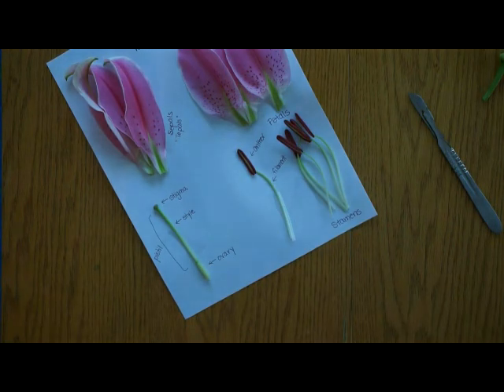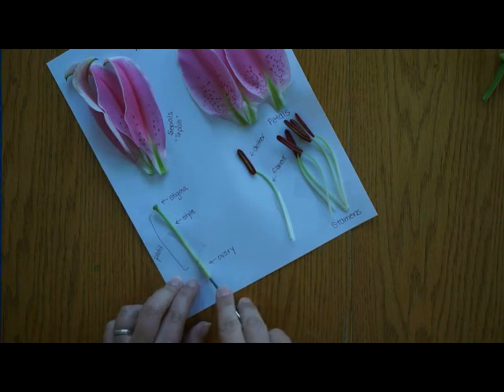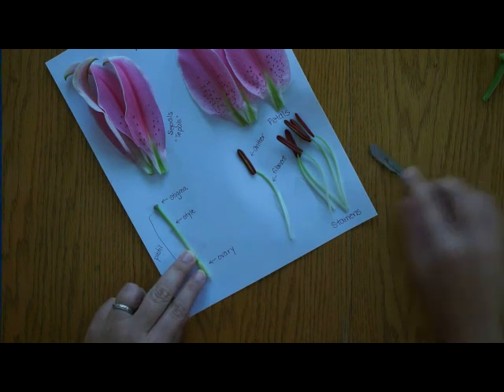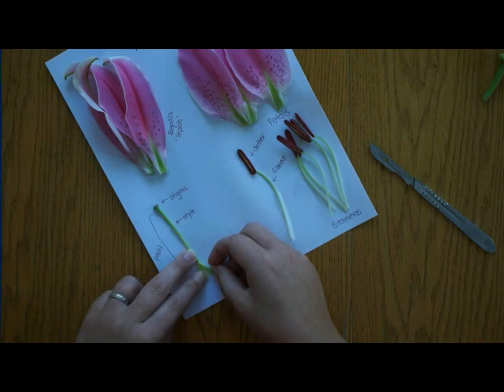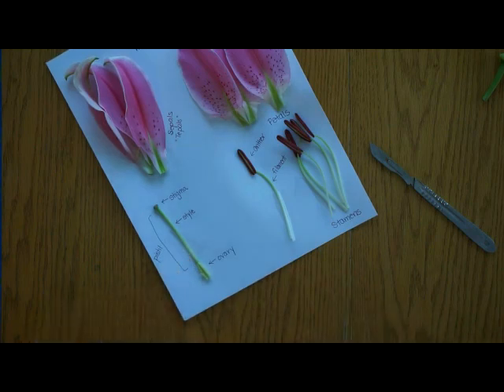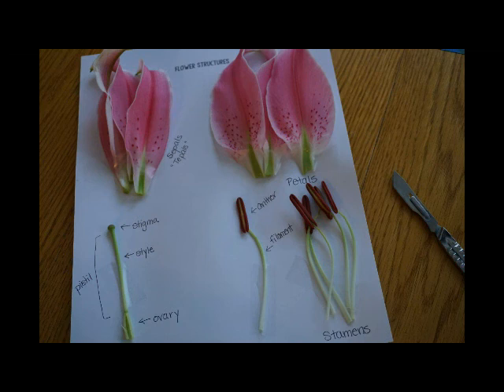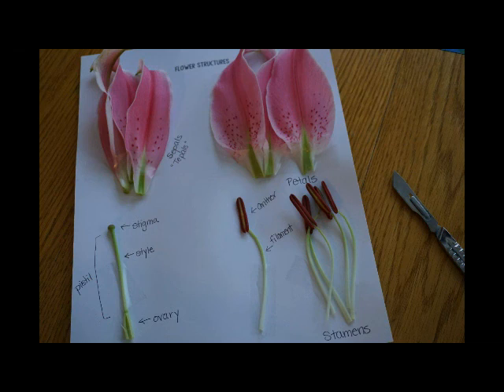If you want, you can actually cut the ovary open. You can't really see anything in mine because it's not very large yet and it's not mature. But if you want to cut your ovary open and see if you can find some ovules in there, feel free. This is what the finished portion of our flower structures page looks like. Don't forget to finish your flower observations and the discussion questions, and then you are finished with your lab.